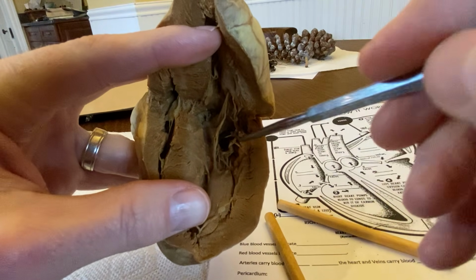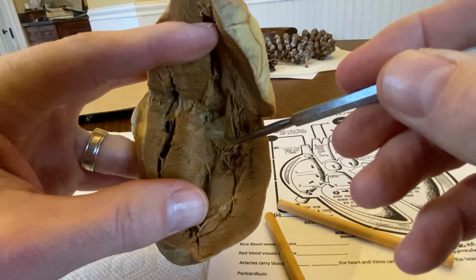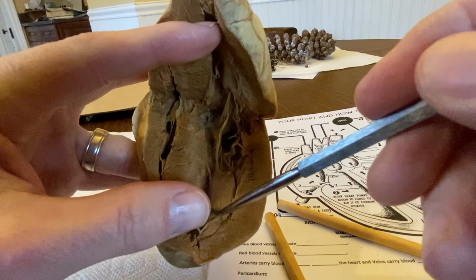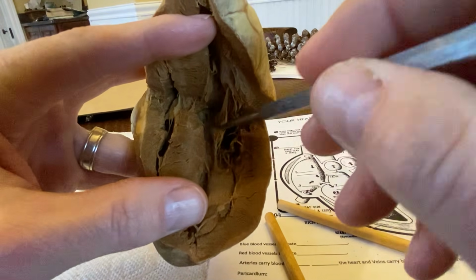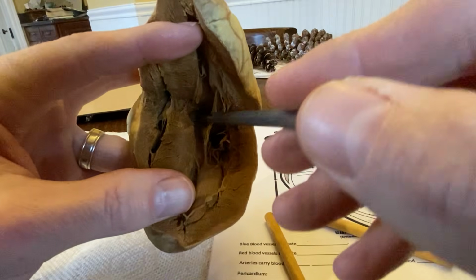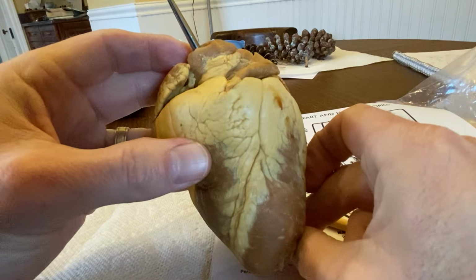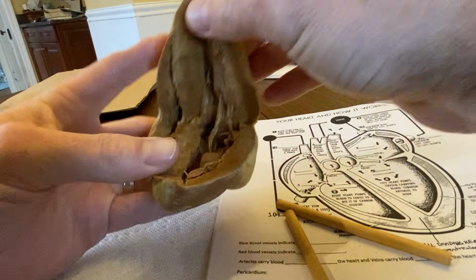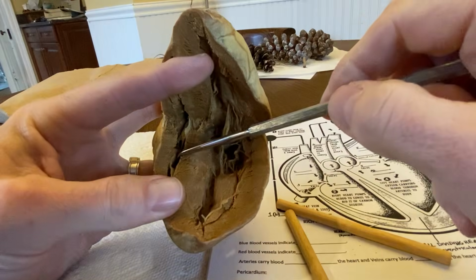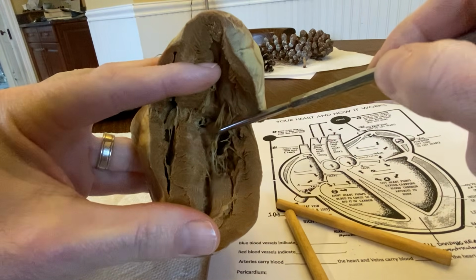And then when the ventricle contracts, it's hard to do because I'm pulling it open, but this valve just folds over like this. So the blood would come up this way, slide along this edge, and go up and out the aorta, which we'll show you here in a second. But this will shoot right up out the surface and out the aorta. So in terms of the internal anatomy, you've got the two ventricles, and one of the valves is visible here, the bicuspid valve.